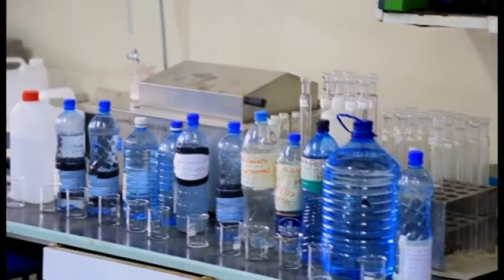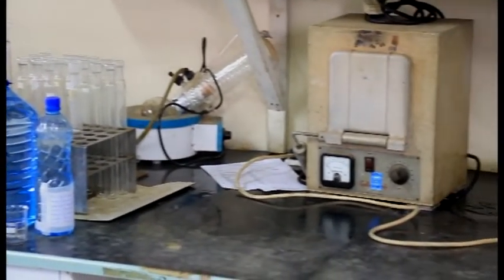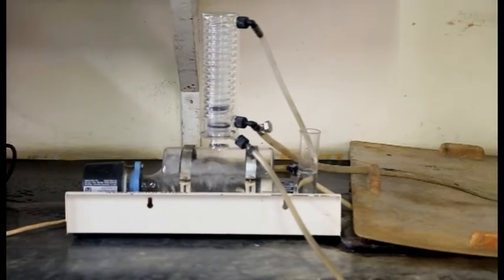Another area is the wastewater samples, which we normally do for external clients and for the WRMA as an institution. Here we do various parameters, mostly physical chemical parameters, but in some cases we also analyze bacteriological parameters.